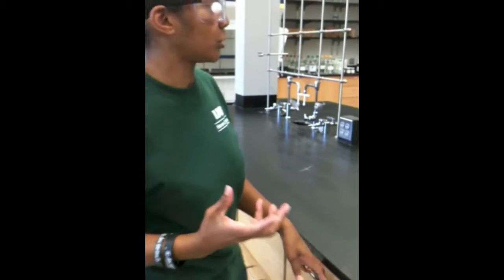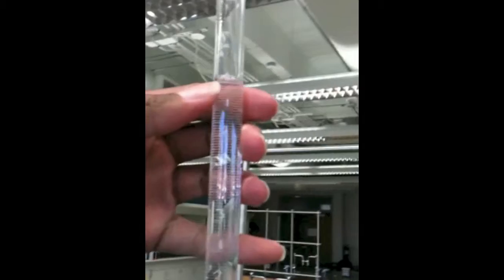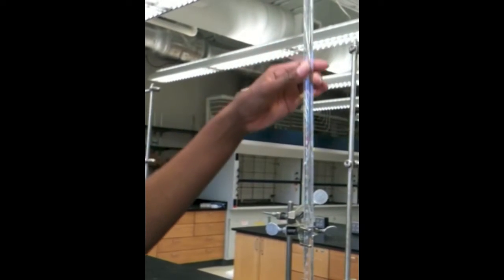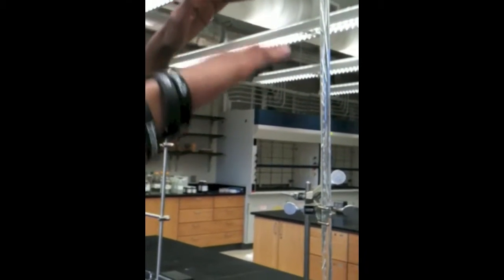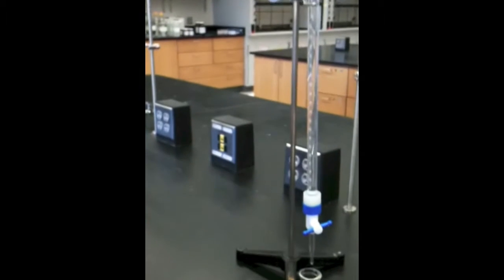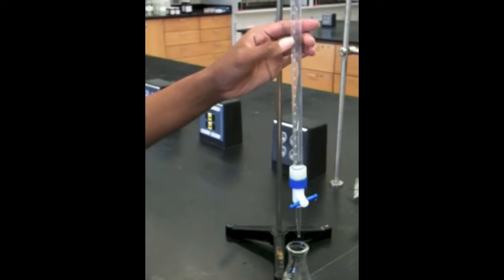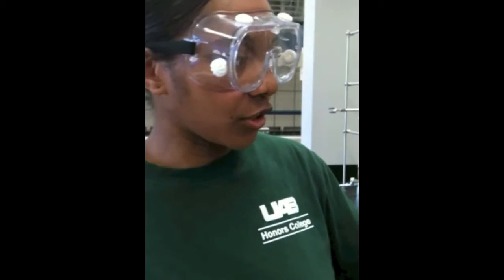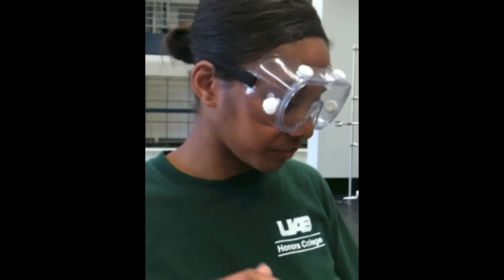And what's really important, you have to know how to record the volume on a burette. So this is a burette. It starts at 0 milliliters and it contains a total of 50 milliliters. The way we determine volume is called volume by difference. You're going to have an initial reading and you're going to record it in your notebook, and then you're going to allow the solution to run out until the solution turns pink, and I'll explain that in just a minute. And then you're going to have a final volume, and that's going to be your final volume that you're going to record in your notebook. And what you want to do is subtract your final minus your initial to give you the actual volume of the solution added to the titrant.